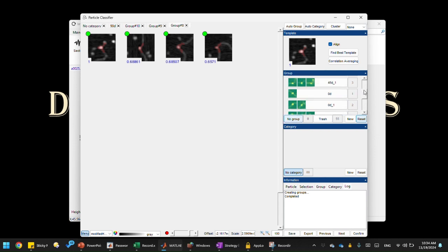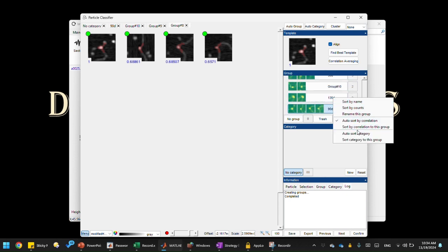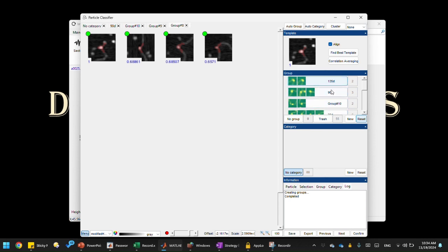And even if you sort them, right? If I sort by 135 degree, you can see it's sorted, 90 degree will come close to 135, right? So it's sorting this correctly. So it already gets the classes very close to each other. So if I sort by the 30 degree, see, 30 degrees, 30, 45 degree, 30 degree, right? So the program does a pretty great job, I think, in classifying the angular conformations of these particles. All right, what do you think?